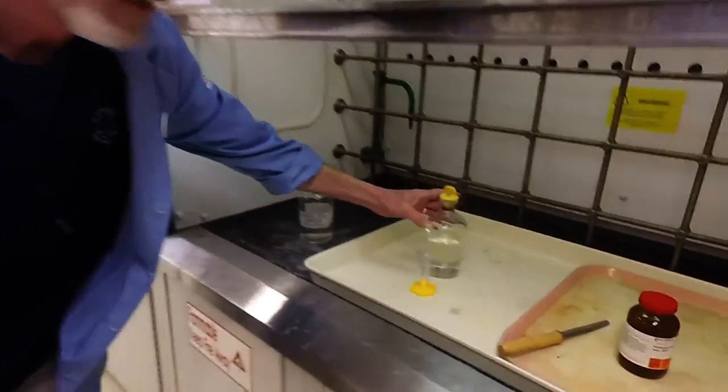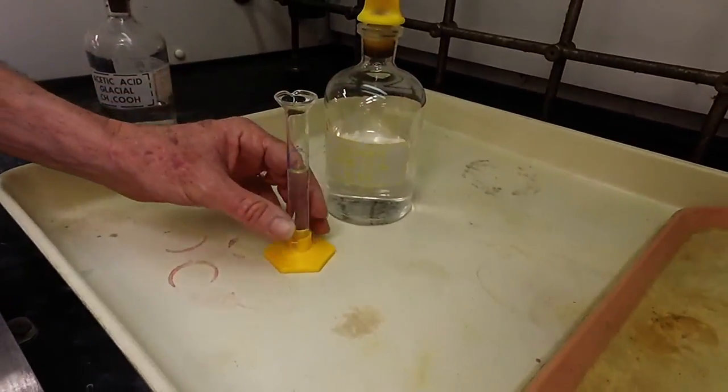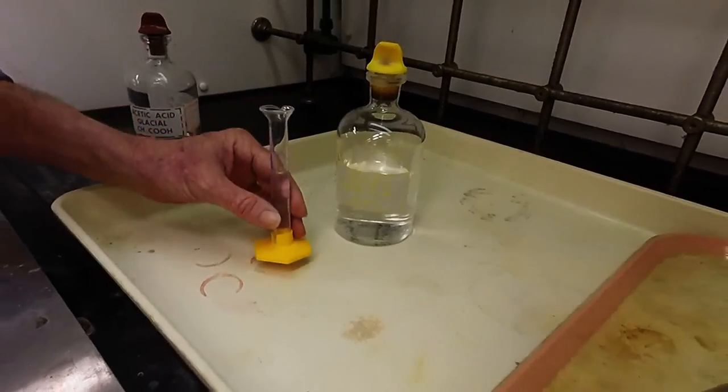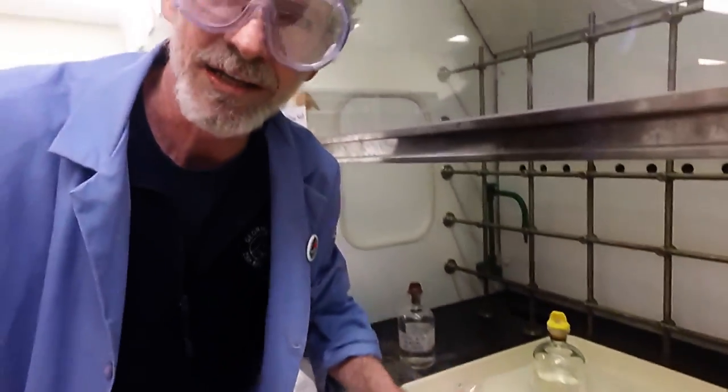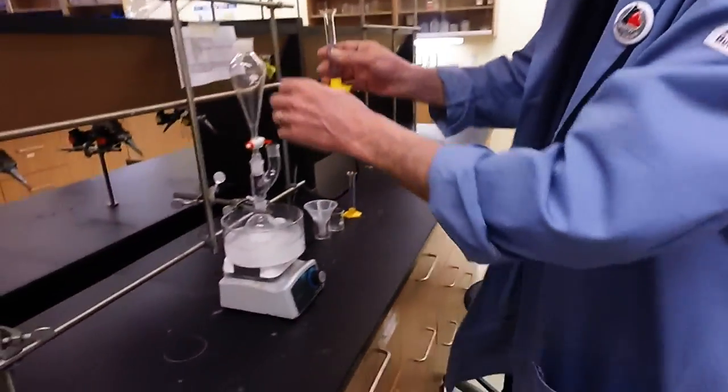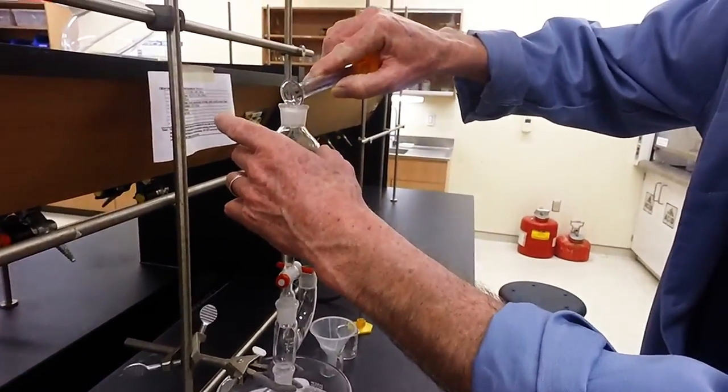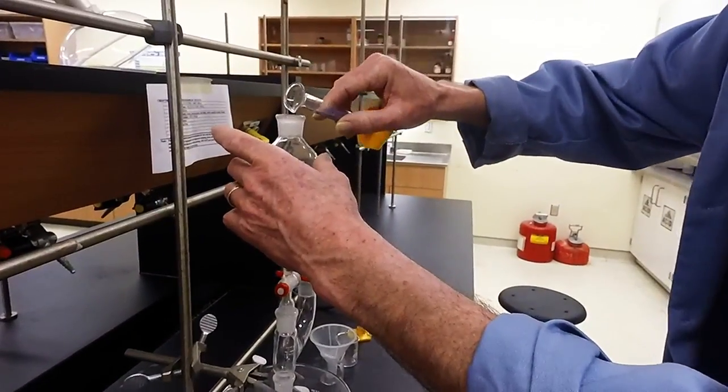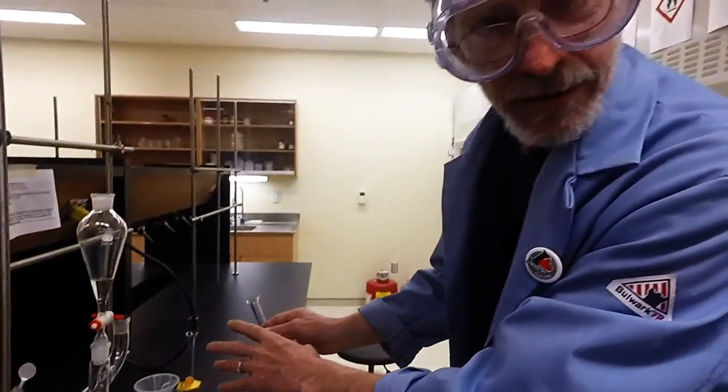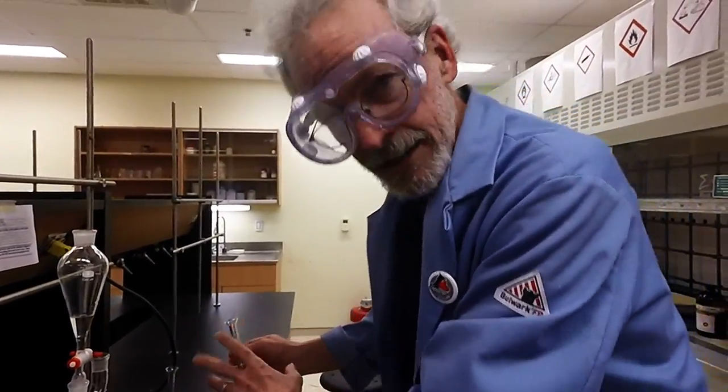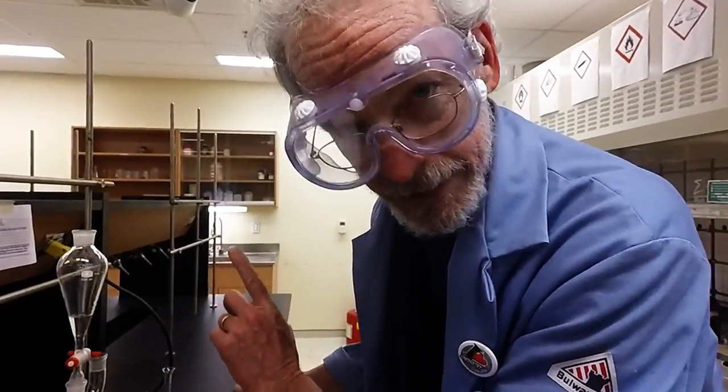Sulfuric acid. Be careful with this stuff. If you get some on you, just quickly wash it off. But, boy, it can hurt a little bit. So, no big deal. Carefully, in goes the sulfuric acid. Now, I've got a lot of glassware here that's got acids and stuff all over it. Let's clean it up right now.